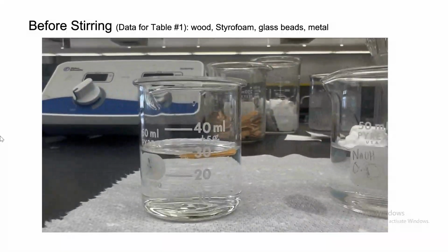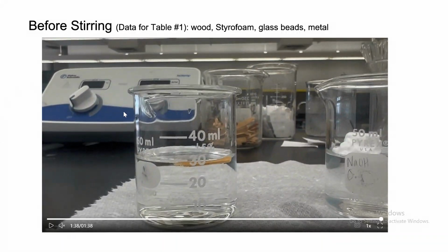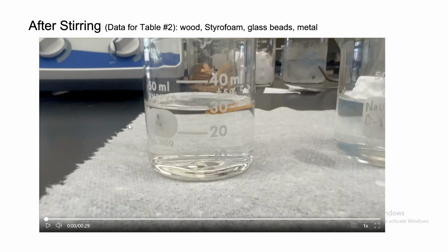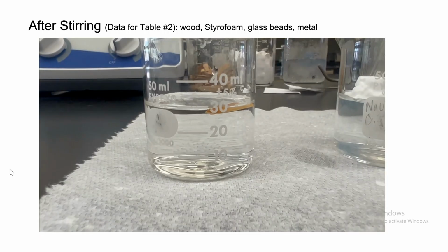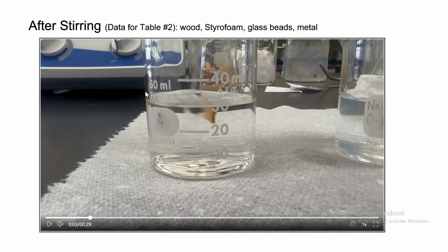Again, here are the observations one more time. And again, if you want to pause the video and rewind, do that. All right, so this is before stirring. Now let's do after stirring. So after stirring, go to table number 2. So we're gonna pause, leave table 1. Let's go to table 2, and let's try stirring these to see if they dissolve in water or not.